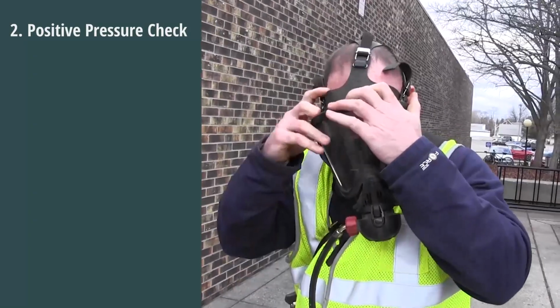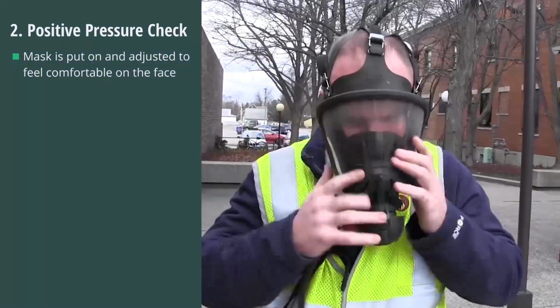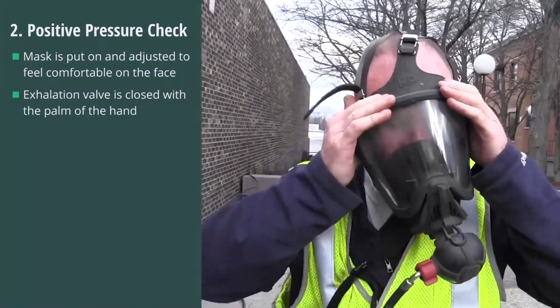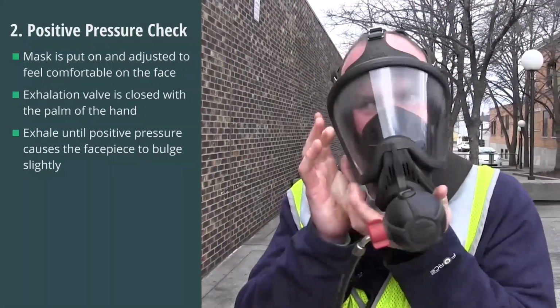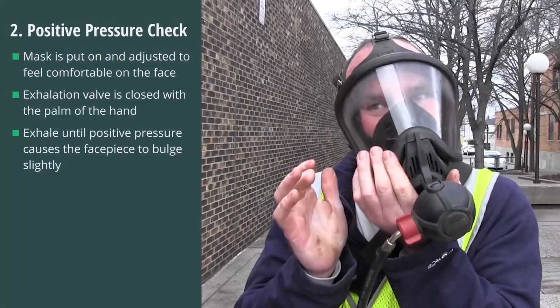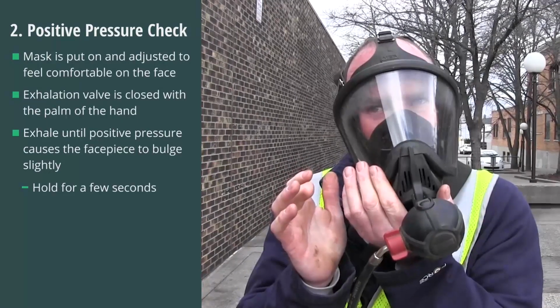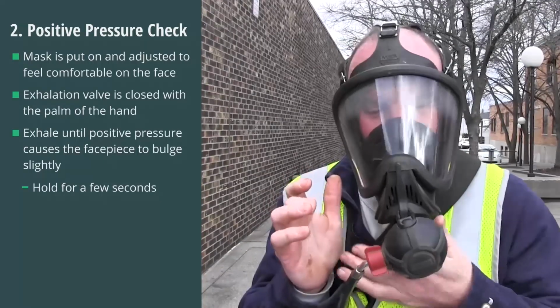The other user seal check is called the positive pressure check. To perform this check, the mask is put on and adjusted to feel comfortable on the face. The exhalation valve is closed with the palm of the hand. Then the individual exhales into the mask until positive pressure causes the facepiece to bulge slightly and holds for a few seconds. A seal is achieved if no leaks can be detected and the facepiece holds the positive pressure.